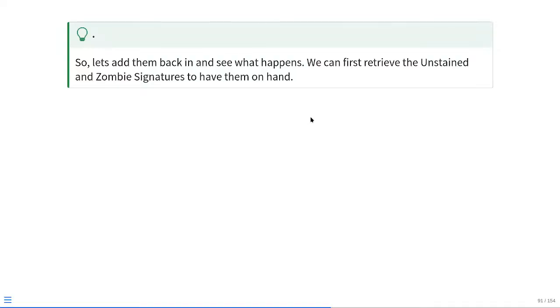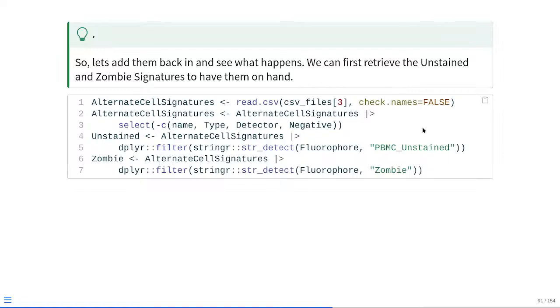So as we saw, we had more residual leftovers when it comes to the later half of our detectors where we expect to see Zombie NIR. Let's actually see about adding in the Zombie NIR signature as well as our unstained signature for autofluorescence alongside those bead signature controls, bead signature references, so that way we're able to account for all the signal that is actually present on the cells. So how are we going to do that?